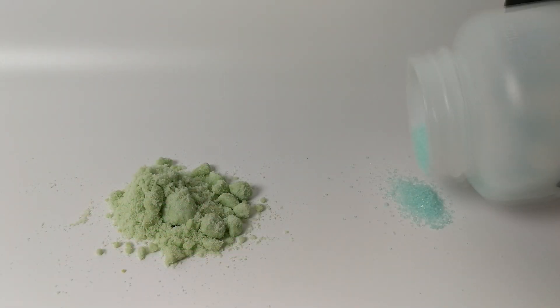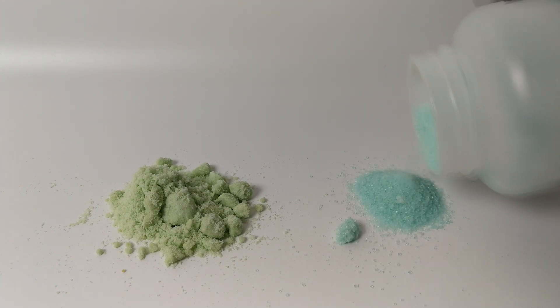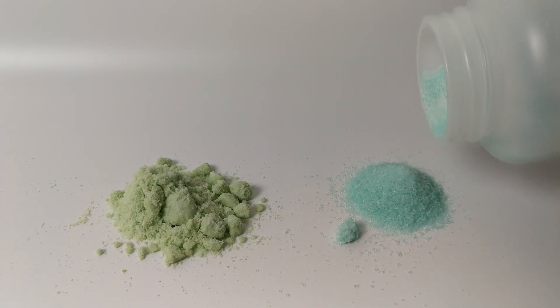Of course, it is quite far from pure when compared to laboratory grade ferrous sulfate, but for the sake of interest I decided to use it nonetheless.